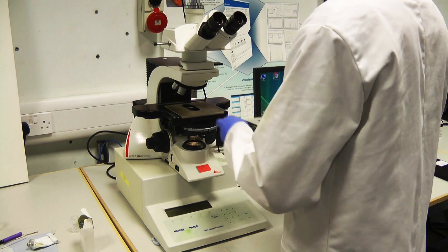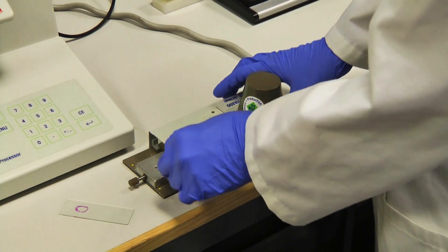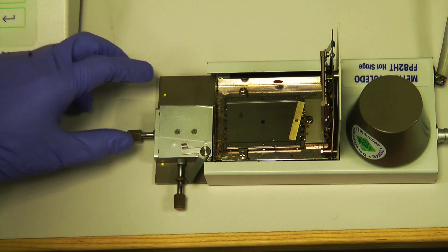Remove the hot stage from the microscope. Open the lid of the hot stage and slide the glass slide into the stage.